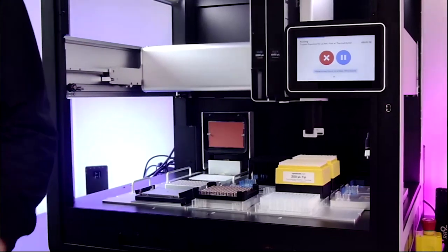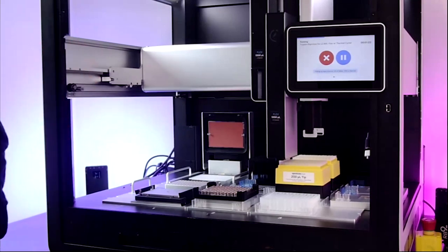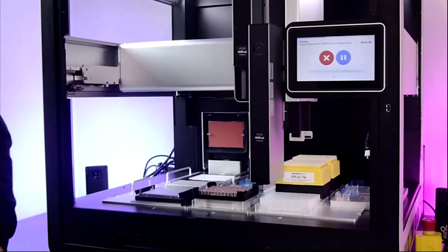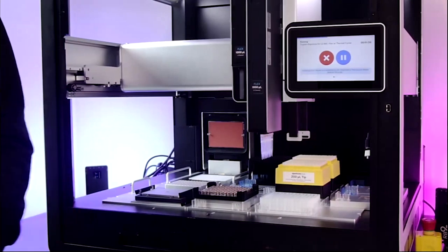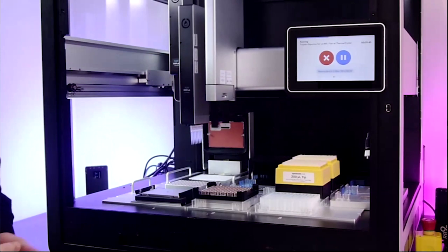As you saw in the tables, this protocol is designed for column-based work. For demo purposes, I just shortened it to only do one sample, but we are still going to use the 8-channel pipette here to take all of these reagents in order to do this quickly. So these will be deposited into the plate that's on the thermocycler.